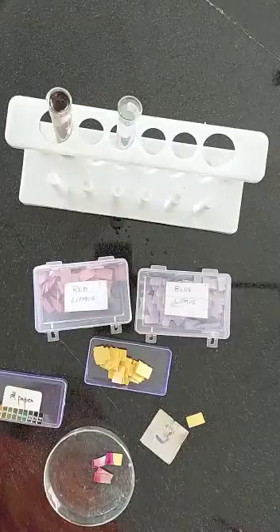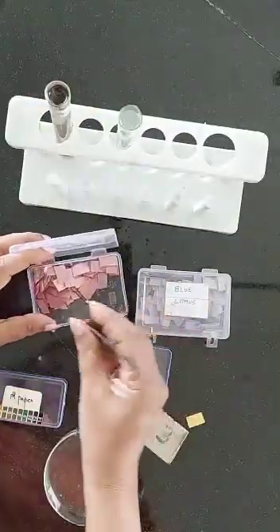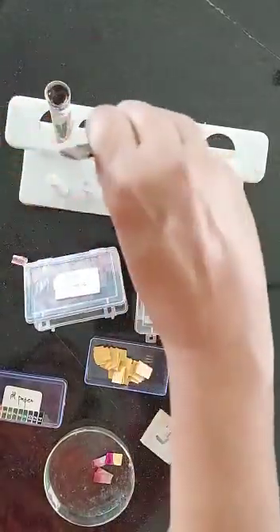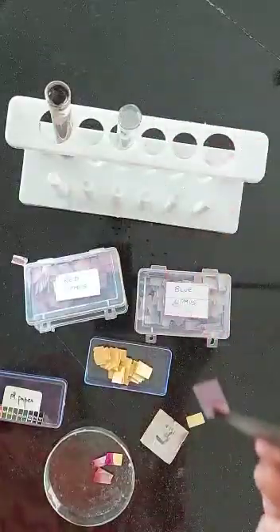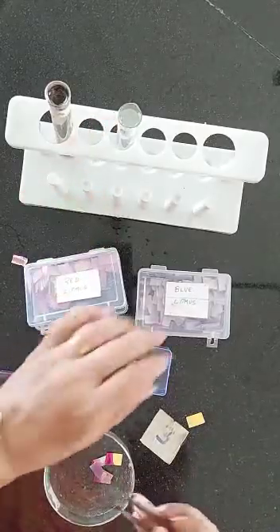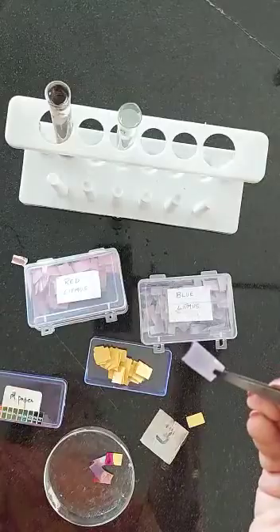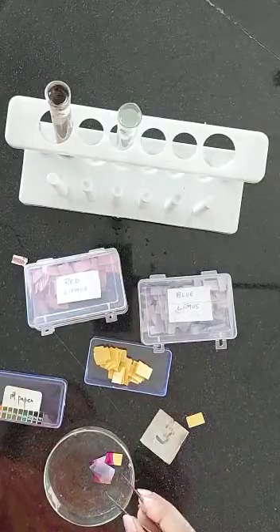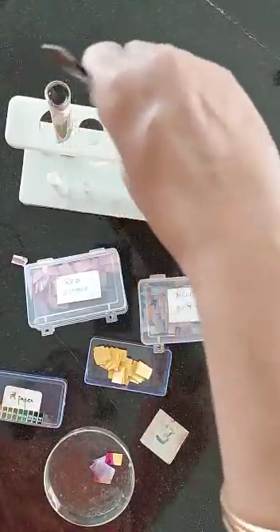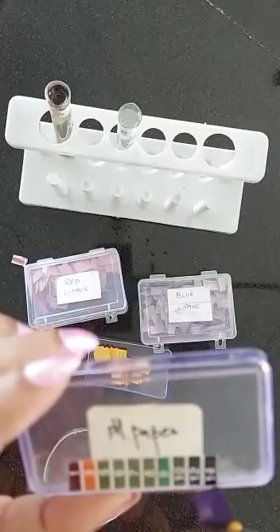Now we will do the same experiment with solution B. I take my red litmus and I dip it in solution B, and I notice that the red litmus has turned blue. So in B, red litmus has turned blue. I take a little bit of blue litmus and put it in solution B — I notice that blue litmus remains blue. Then I take a little pH paper and dip it in solution B. The pH paper is yellow in color, and you can see it's turned dark blue. When I compare it to the strip, dark blue would be number 14.